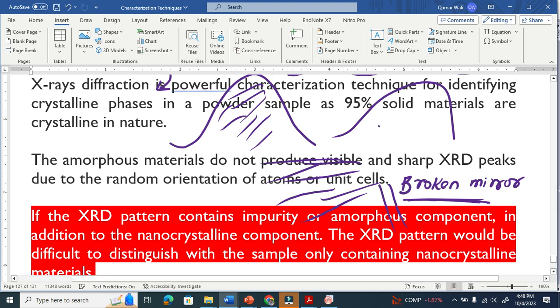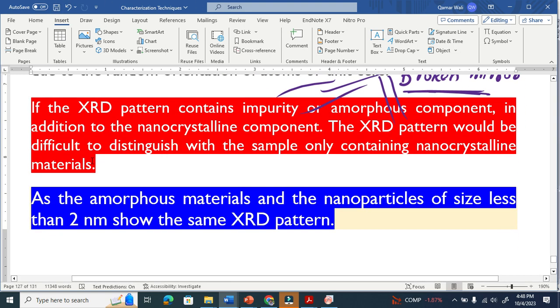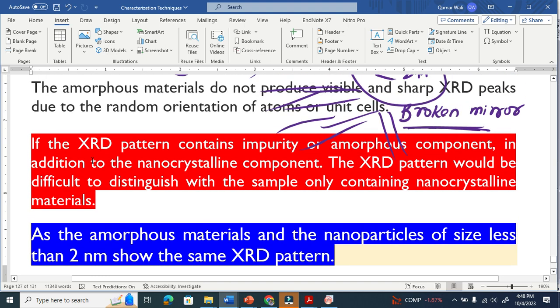Similarly, if the size is less than 5 nanometers, or less than 2 nanometers, the XRD pattern also gives broad peaks similar to the amorphous material. So there is a huge discrepancy here. Look at these two statements, very interesting, right?